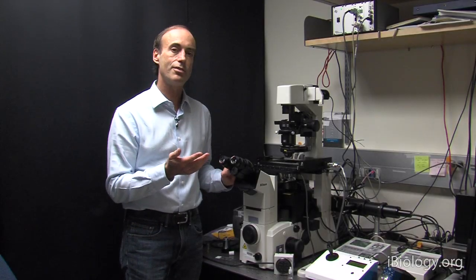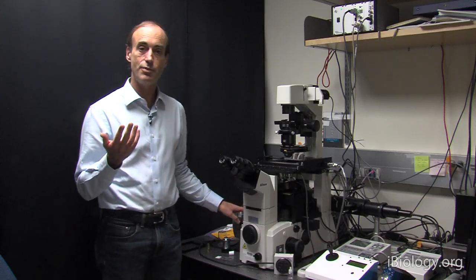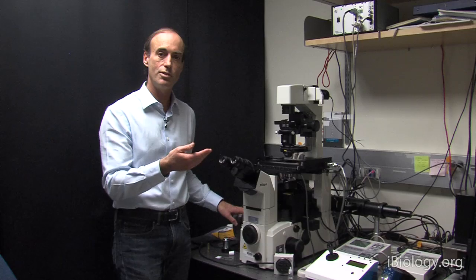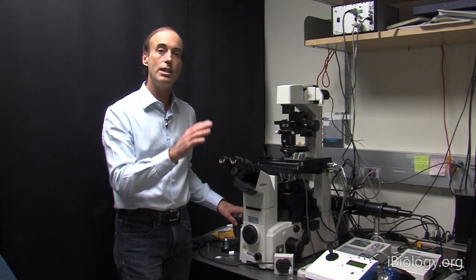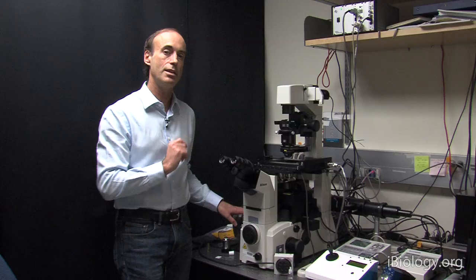In which case it may be very difficult to see the single molecule fluorescence with the eyepiece. And in that case, you may have to direct the light to a very sensitive camera and actually undergo the same kind of focusing routine, but now looking at the image from the camera to focus, rather than the eyepiece.